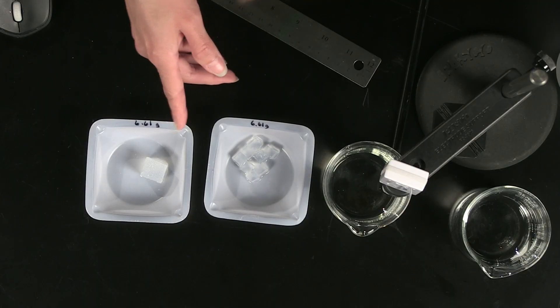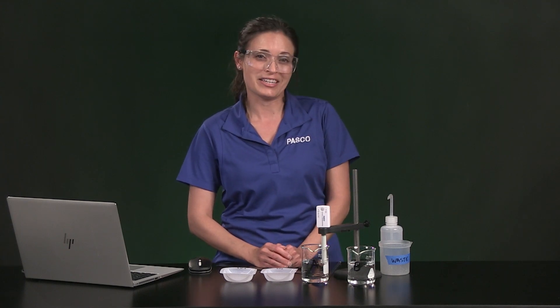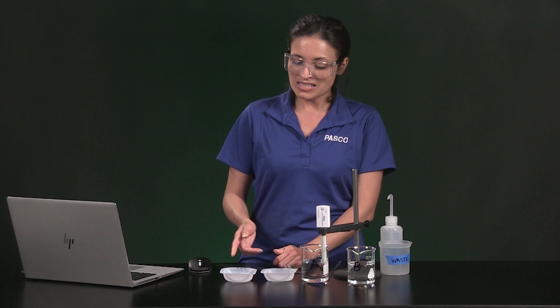I made these gel cubes by boiling agarose powder and salt water, and then I poured the solution into a small tray to let it cool and solidify. So this is like salty gelatin.